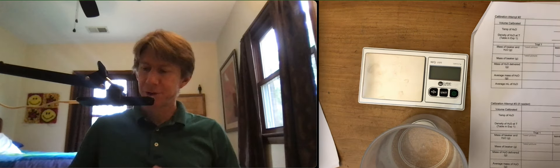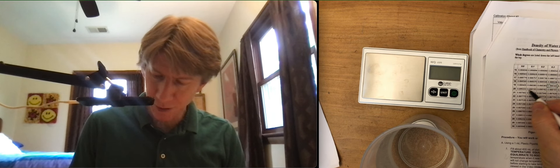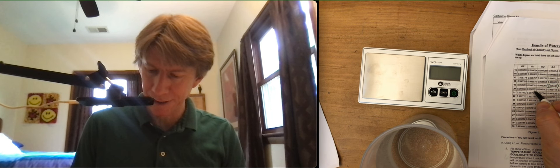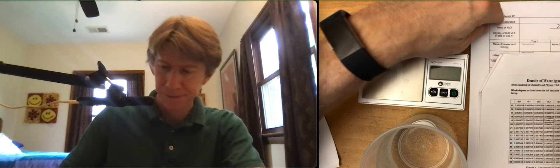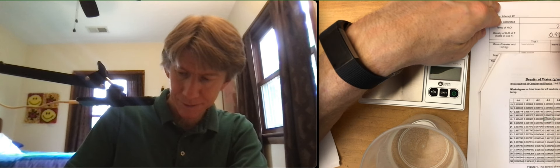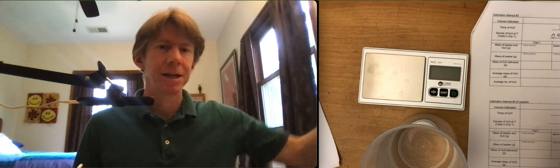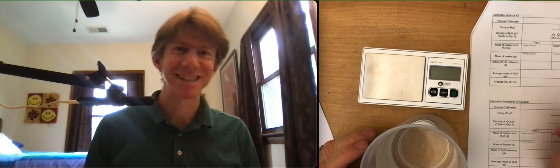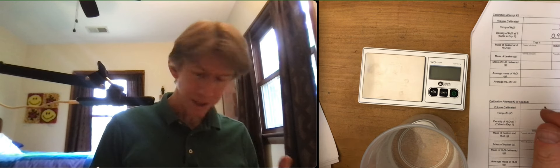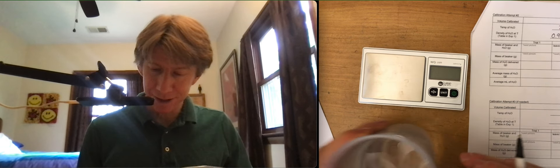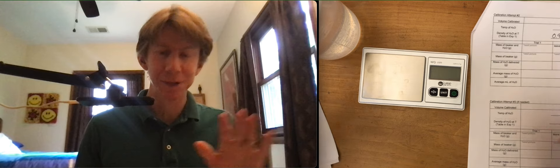So 20.1. Check my temperature over here for the density. 20.1 is 0.998183. So many significant figures. It brings a smile to my face. All right. So now let's do it again. And my tables are still wrong, but I'll fix them for you. Mass of beaker is going to go here.